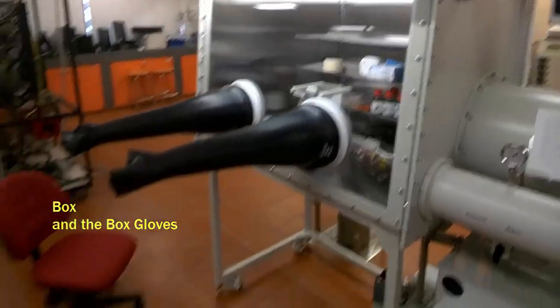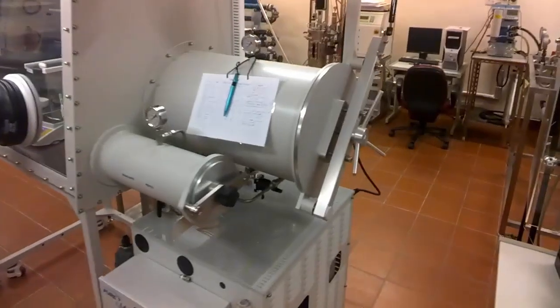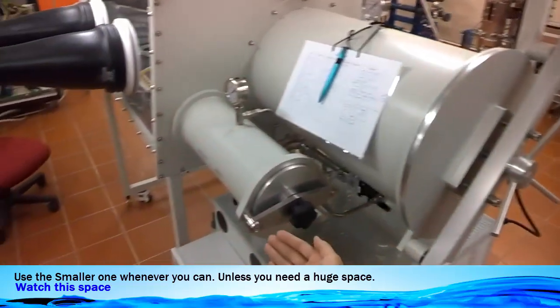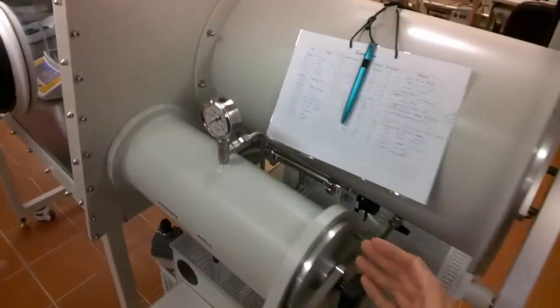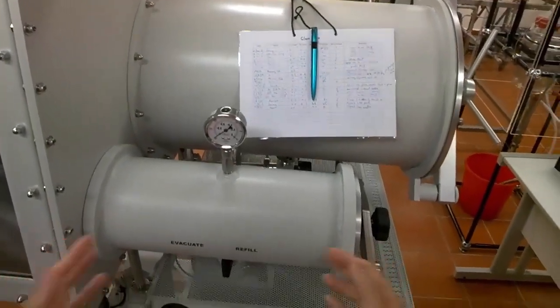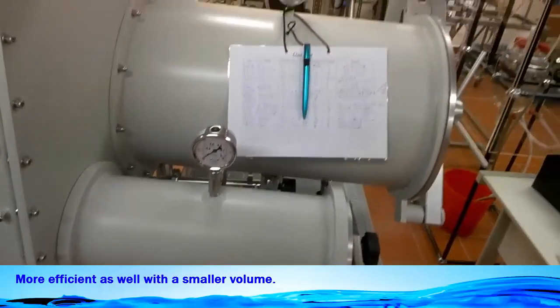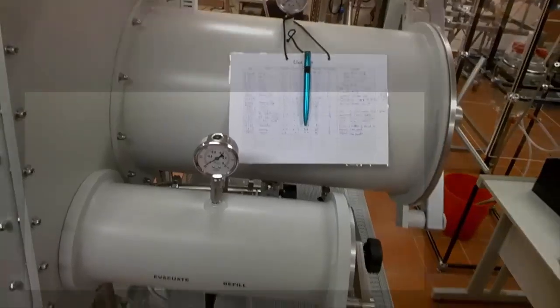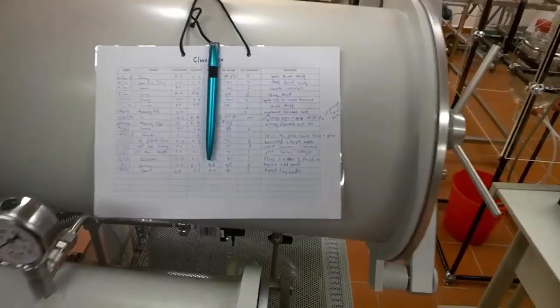You see that there are different parts to the glove box: the box, the box gloves, the large antechamber and the small antechamber. Most of the time, if you could, we utilize the small antechamber because you know that the volume here is smaller. So it will be faster for us to evacuate the whole antechamber and to pump in nitrogen gas. We will also minimize the wastage. And if the glassware or the substance that we are going to put inside the glove box to work is small enough, we apply the small antechamber because it will take a very long time for purging and evacuation of the antechamber to occur.